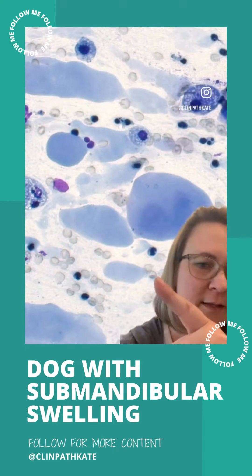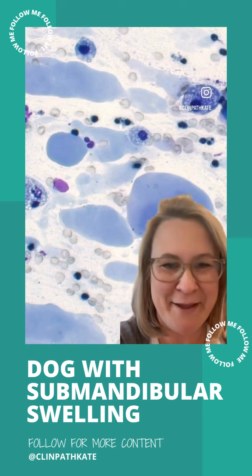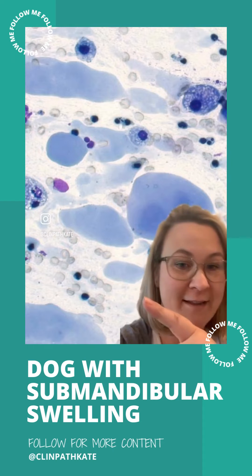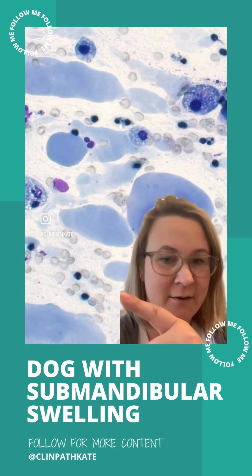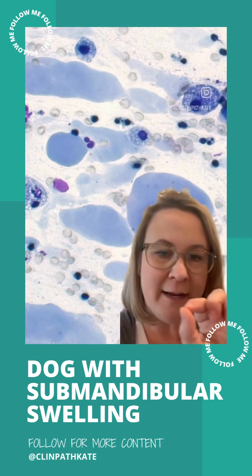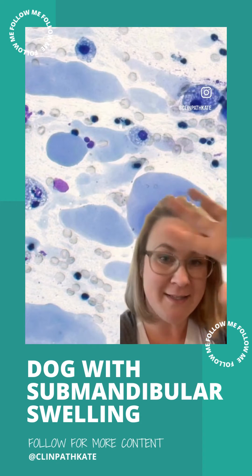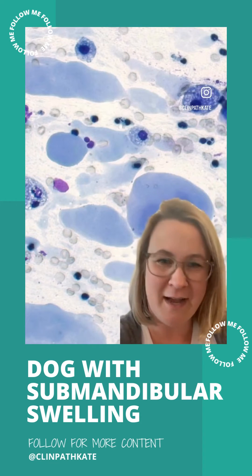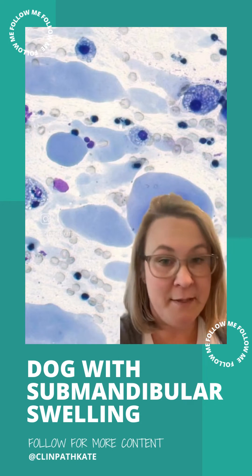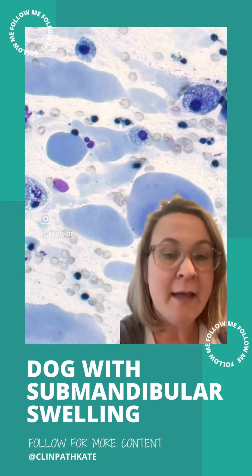We've also got some blood. These little things are red blood cells — they just stain kind of pale. One other thing to notice here is that the red blood cells, it's easier to tell here, they are doing this thing called windrowing, where they're lining up in these rows. It's subtle, but if you look closely, you can see everything in here is kind of lining up in rows.